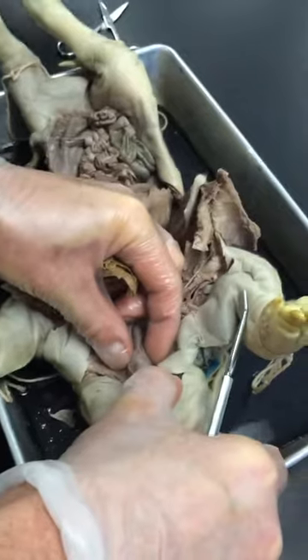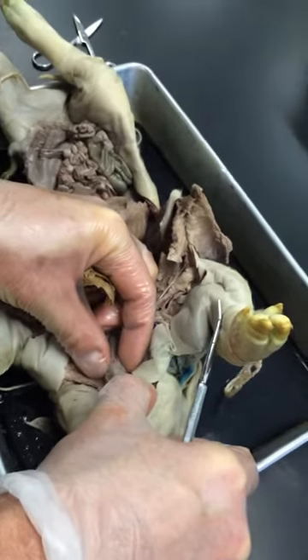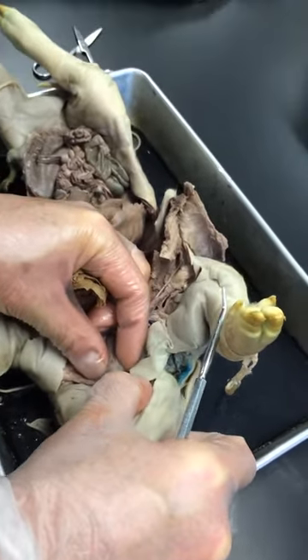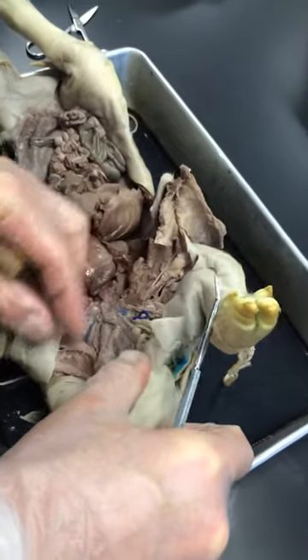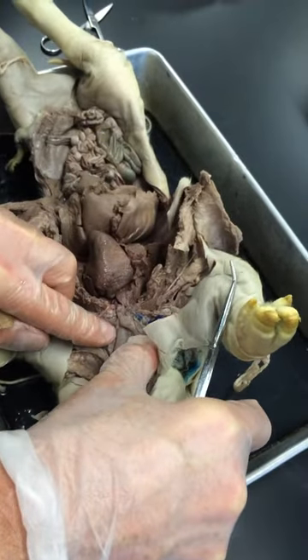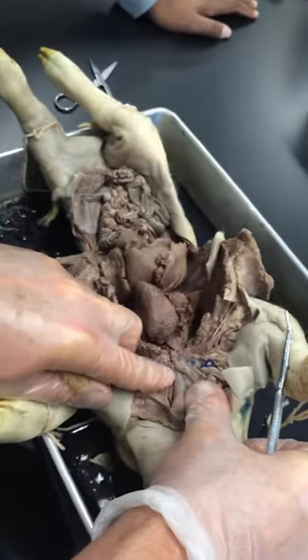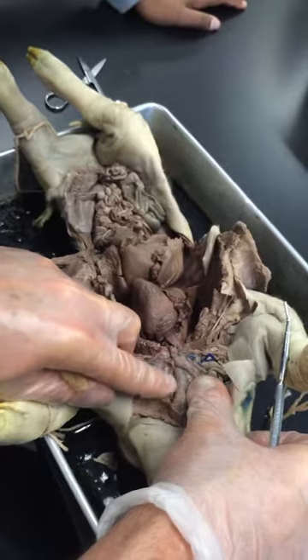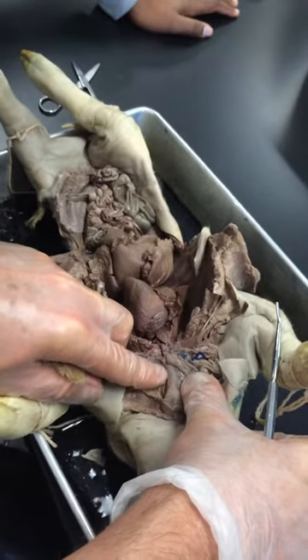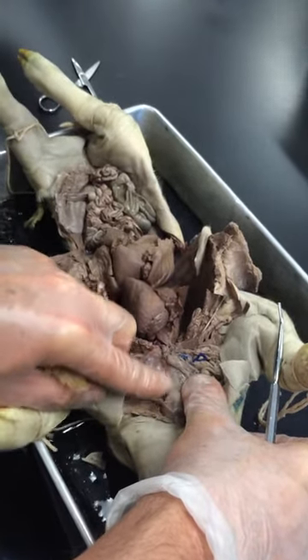Student: So the flappy part is the glottis? Instructor: No, the flap is the epiglottis. The glottis is the hole. The trachea is this ridged tube right here. It looks ribbed because it's got cartilage, just like ours, to keep it open. That's the windpipe.